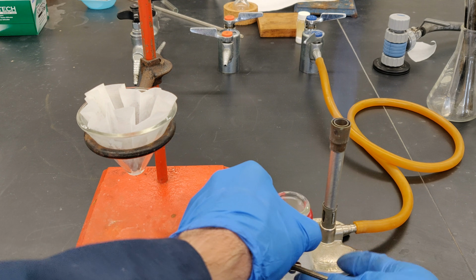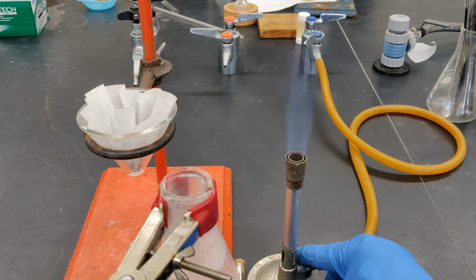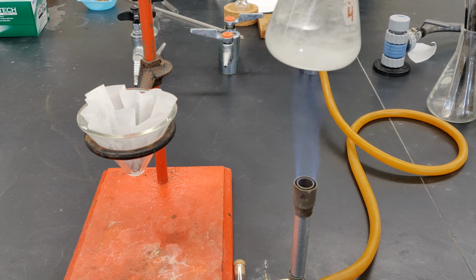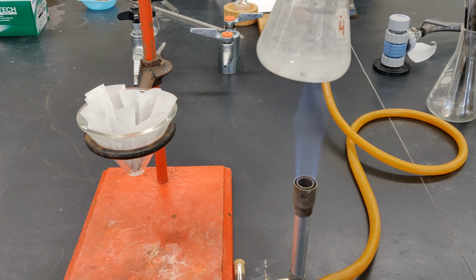Now, firmly clamp the flask and reheat the solution over the burner flame until all solids have redissolved to afford a clear solution. Don't add any more water. You already have enough present to dissolve all the cinnamic acid, and there's no need to filter the solution to remove insoluble impurities since you've already done that.